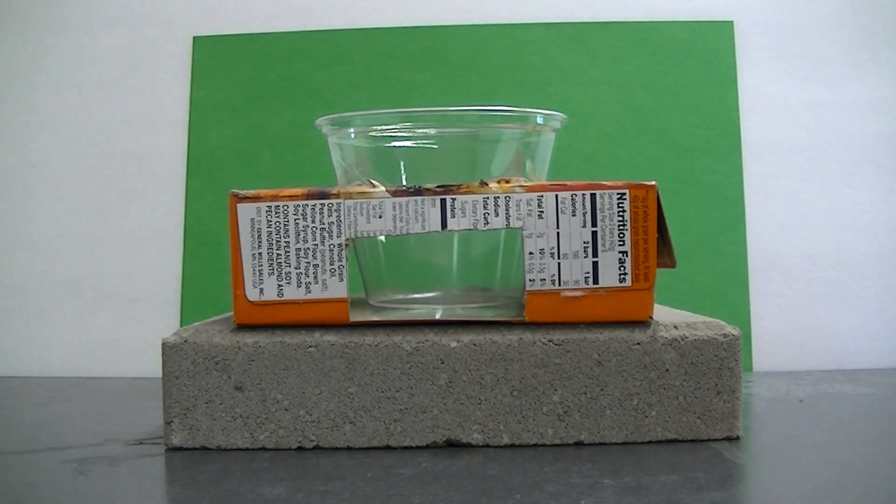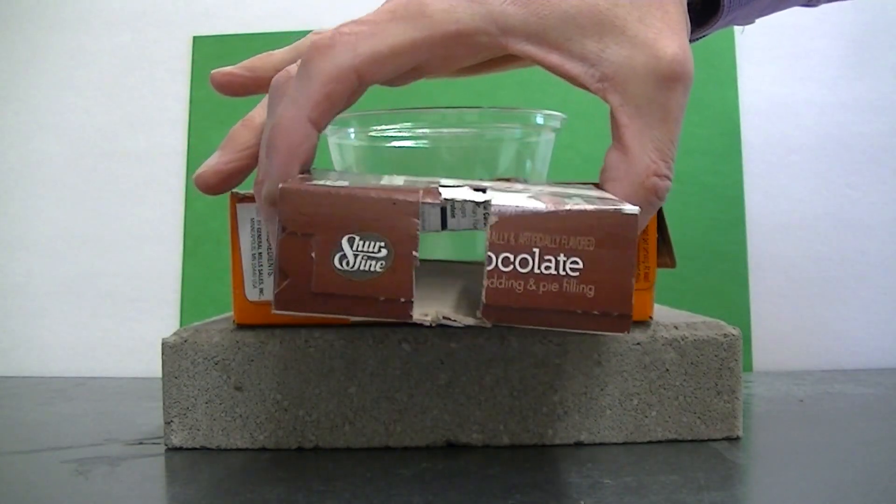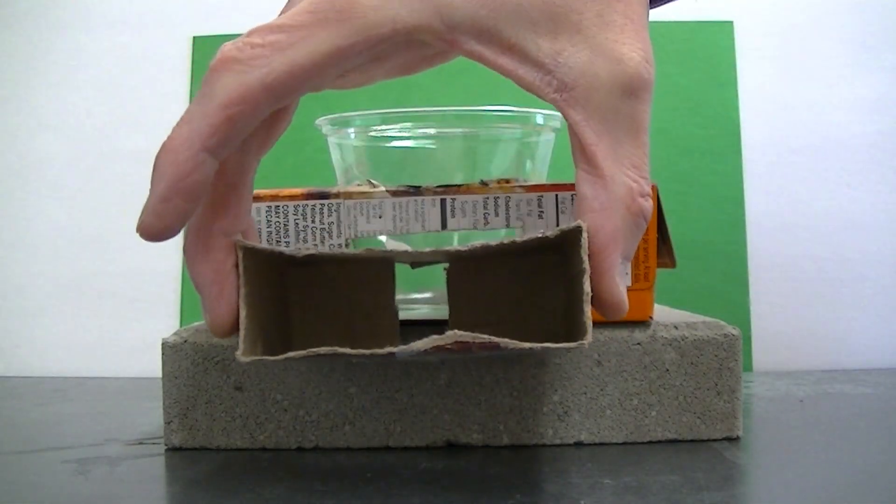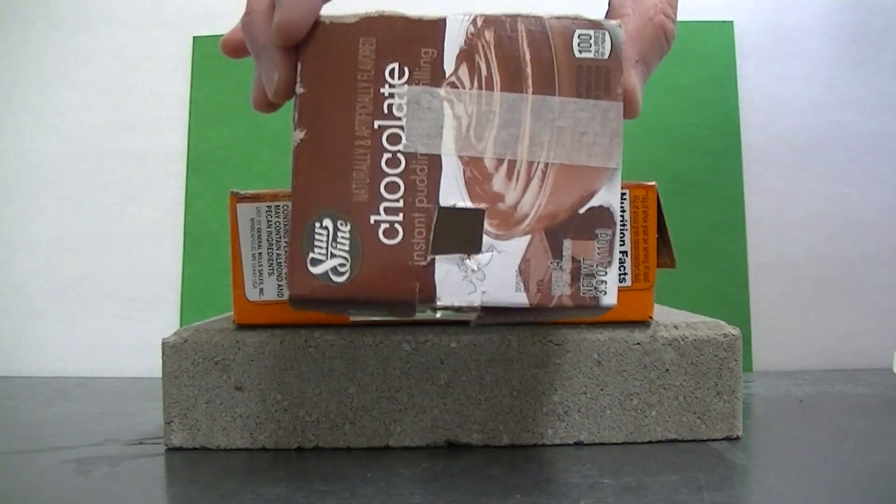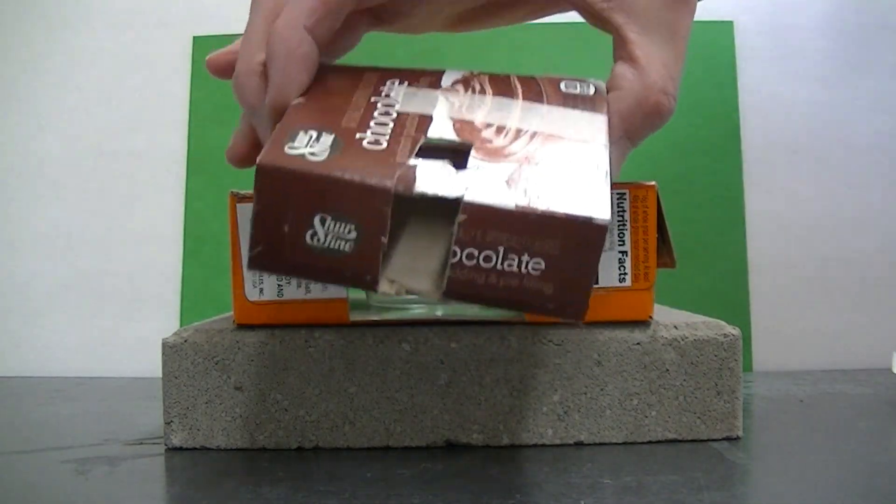You don't need to choose a Solo plastic cup. There are all sorts of things that you can use. This is an example of a sample box that I cut to hold cuvettes. And once again you're going to want to cut your box so that the sample rests near the front of the box.